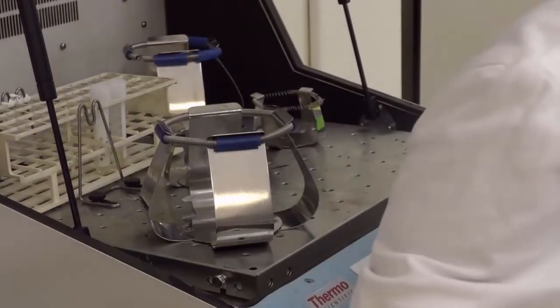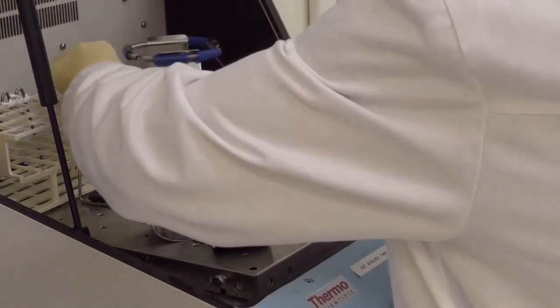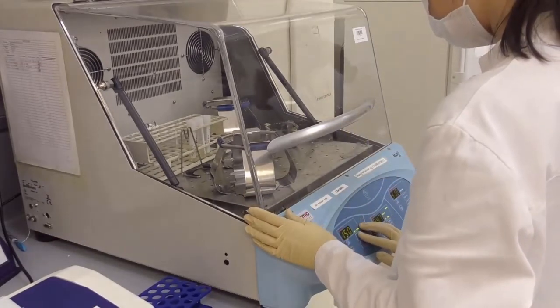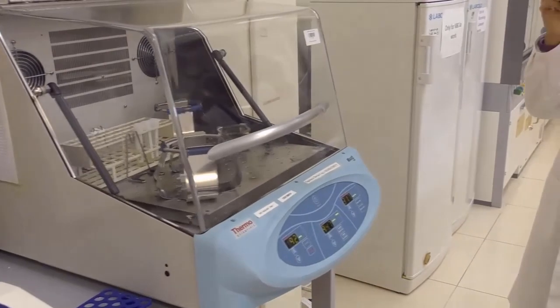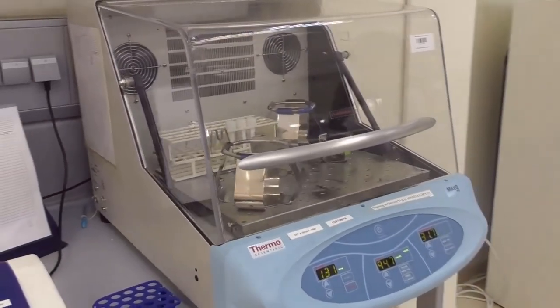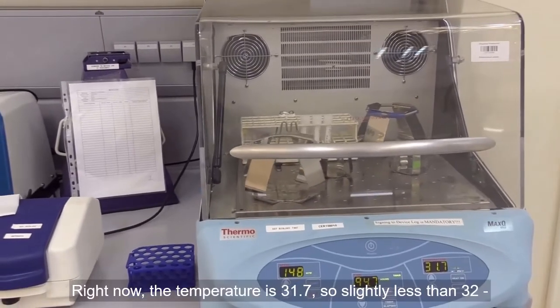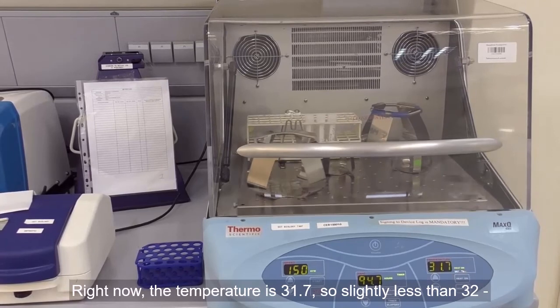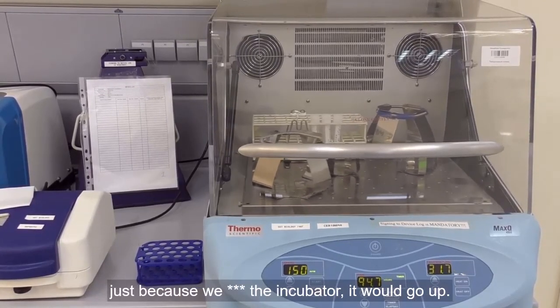After transferring the tubes into an incubator, set up the rotations per minute. And in this case, as you can see, it is 150 rotations per minute. Make sure that the temperature is set to 32 degrees and press start. Because of the open frame construction of our incubator, the temperature will go easily below 32 degrees, so you can see 31.7 now, but of course it will go up.